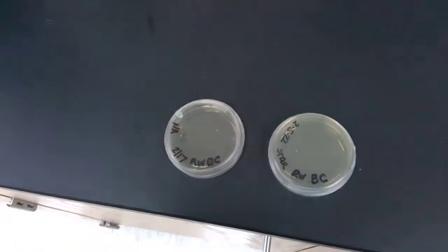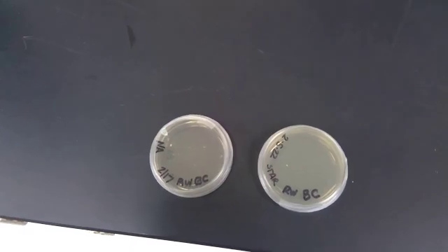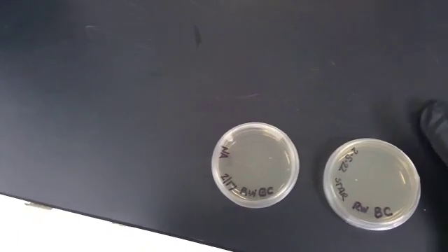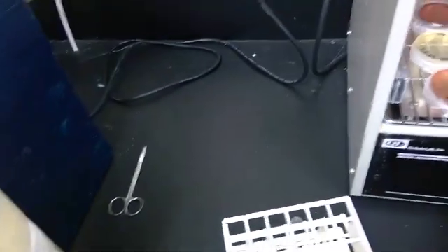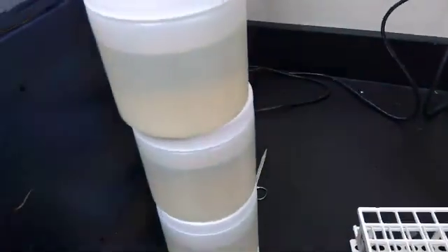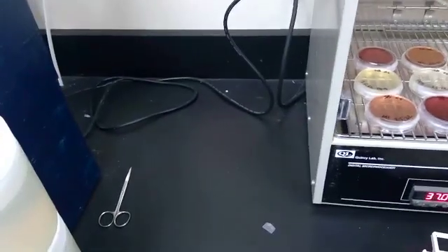As I showed you in the Bergey's manual, different bacteria like different temperatures. Since we have 2 incubators, I know that Bacillus cereus likes 37. So when I put this into the incubator to incubate for 48 hours, I'm going to use the 37-degree incubator. Open it up, put my plates in. And as you can see, we've got other plates from my students. My face-to-face students, I should say. And as you can see, my face-to-face students have their own plates in there incubating.